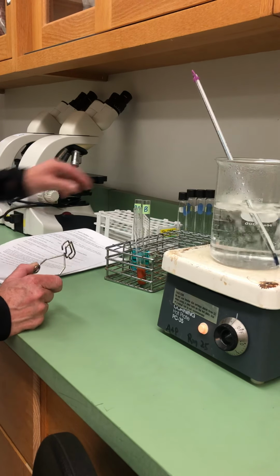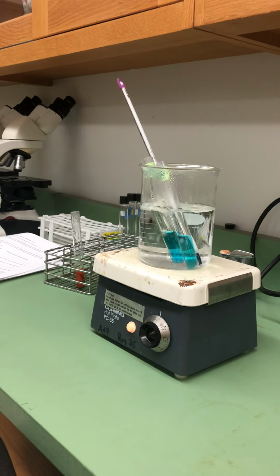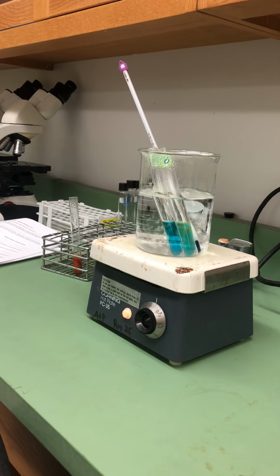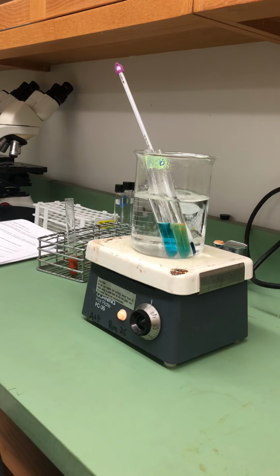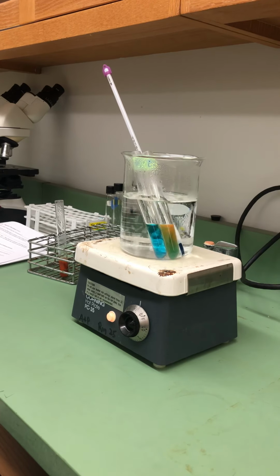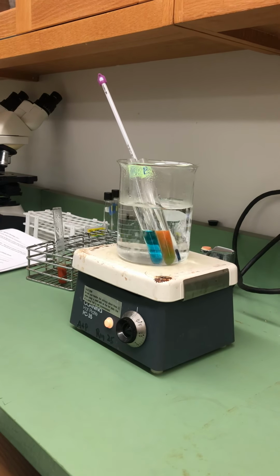and look to see what color changes occur. Think about what your predictions are for the color change and watch immediately for any change. The B vial indicates the Benedict's test performed on the amylose when enzyme was added, and the BC represents the control in which we had amylose with just Benedict's added.